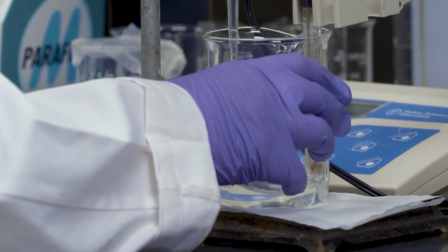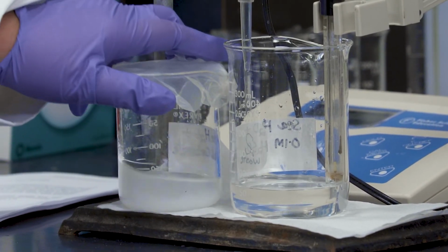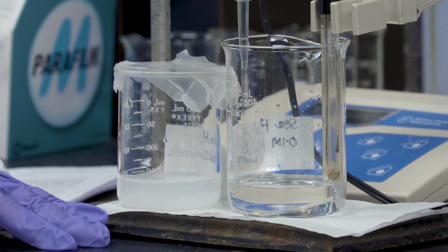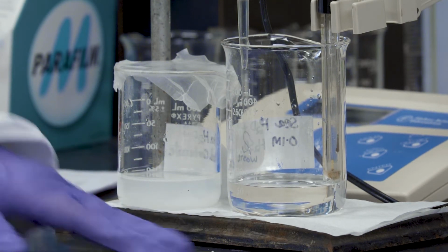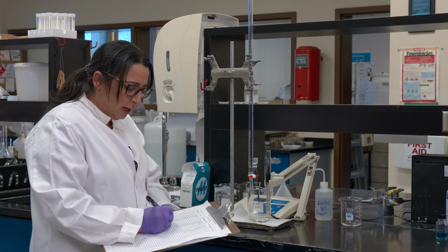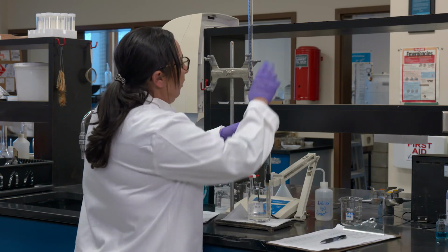Okay, here we are. Just another zoom in here. Look at that. So with approximately 11 mils of acid, we have reached our first equivalence point. Okay. And my reading is into the 8th zone now, so I got the pH of 8.91. So I'm going to continue again.